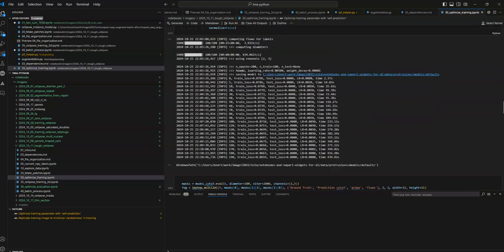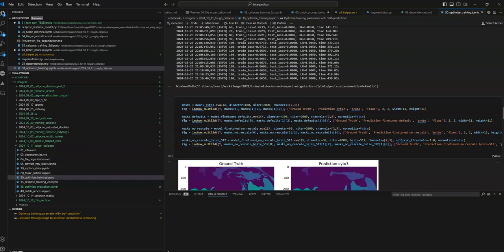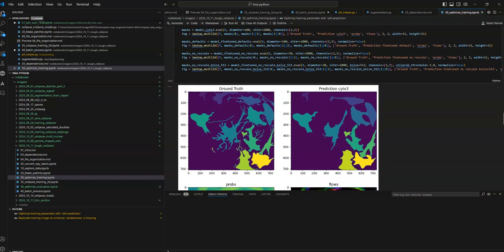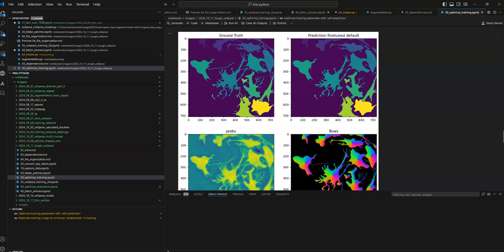With the default settings, these images are probably rescaled inside the training process. And then when you evaluate, since they were rescaled during training, you have to rescale during evaluation, and you do that by increasing the diameter a bit. Another option is to train with rescale false.